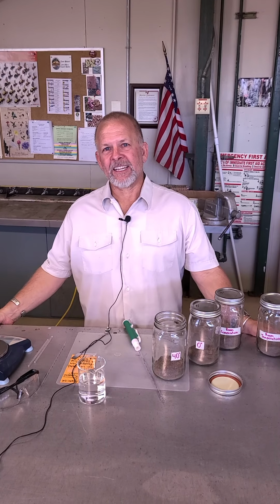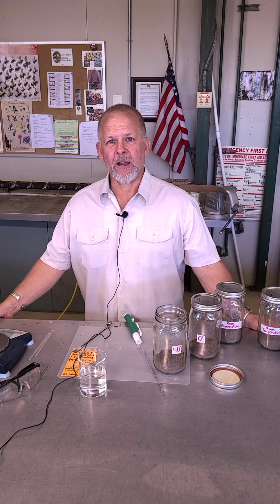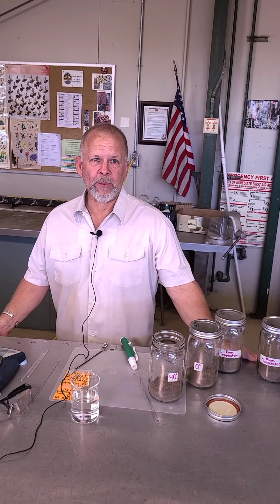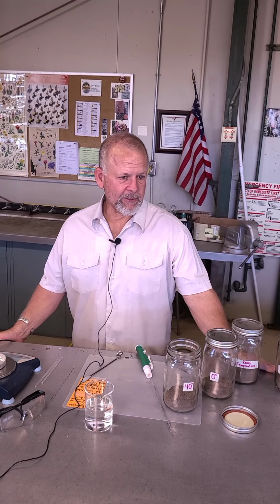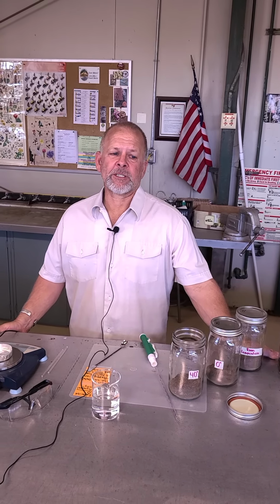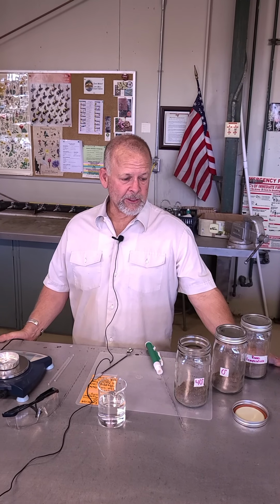All right, hi there. This is AGNR 131 Soil Science, and we are working on lab exercise number 10 today, which is soil microbial activity. Now, how we're going to measure that, there's lots of different ways to measure it. It's easier to measure it in the field. Unfortunately, we're not in the field. We're going to do it here in the lab.